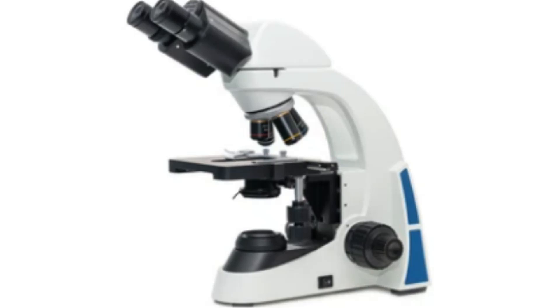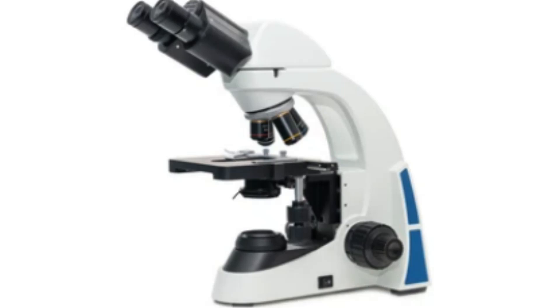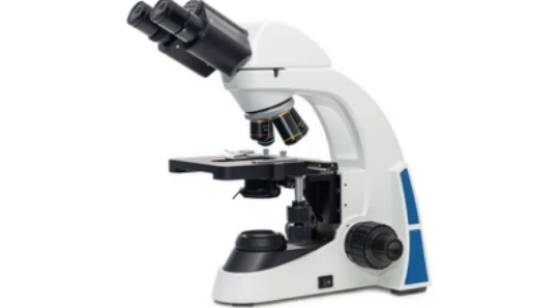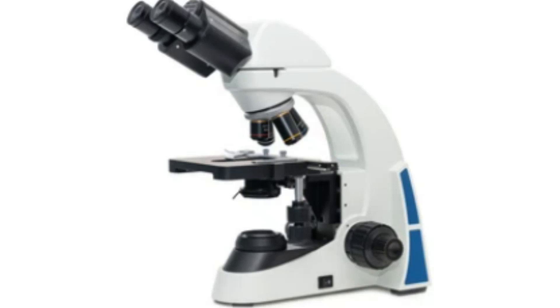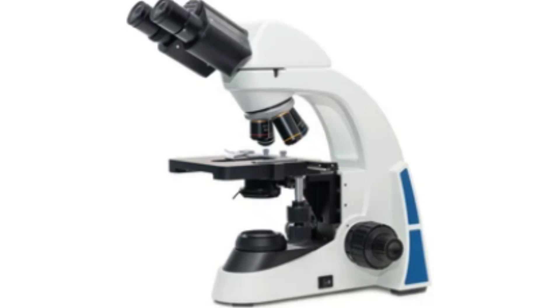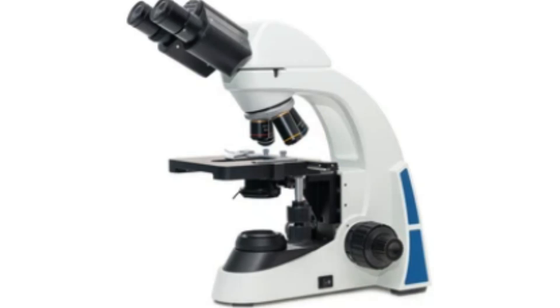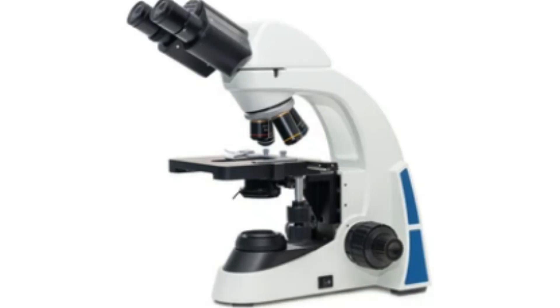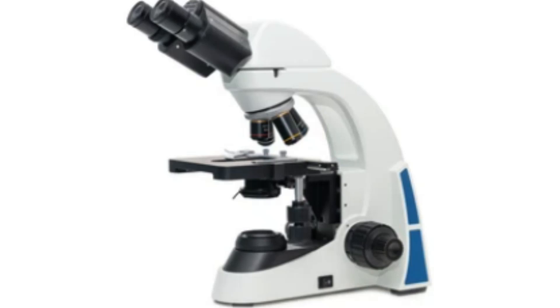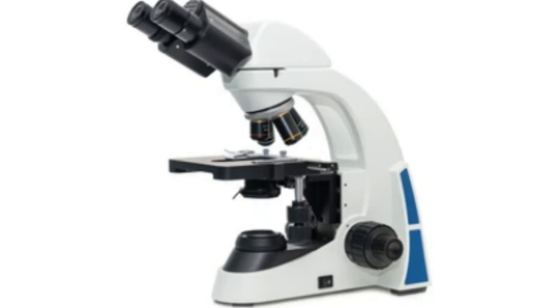A polarizing microscope is often used in petrographic analysis, which involves the identification and classification of rocks and minerals based on their physical and chemical properties. By studying the way that light interacts with the mineral structures, geologists can determine key features such as the mineral's optical properties, birefringence, and pleochroism.